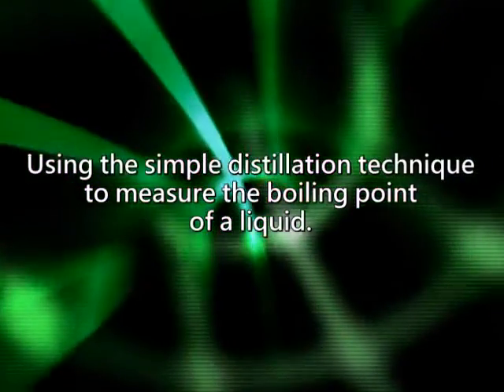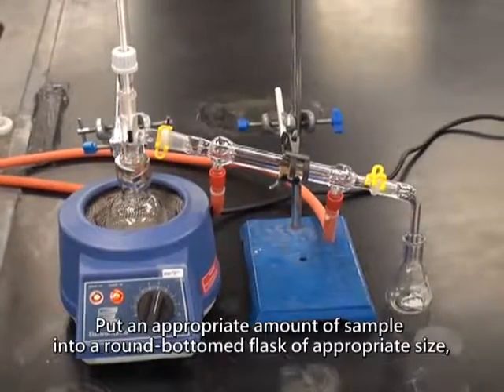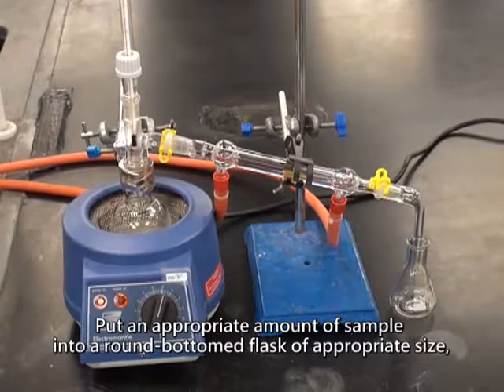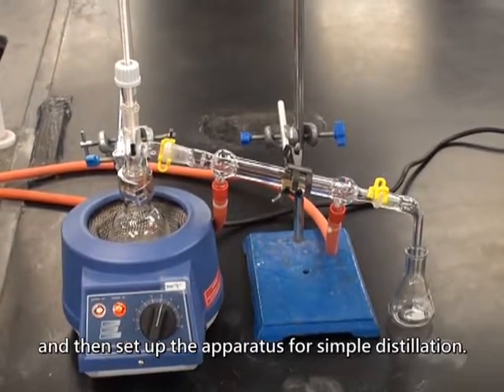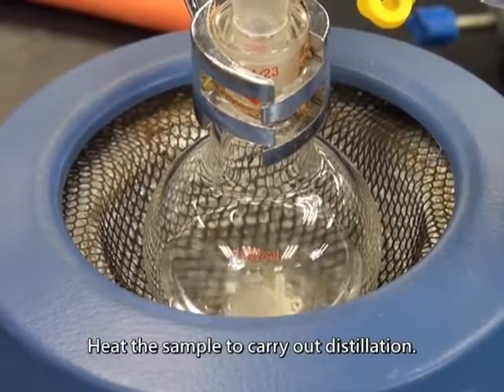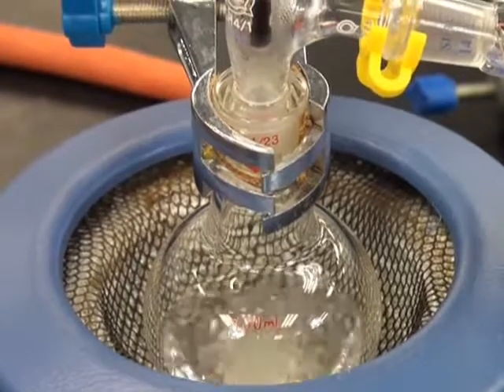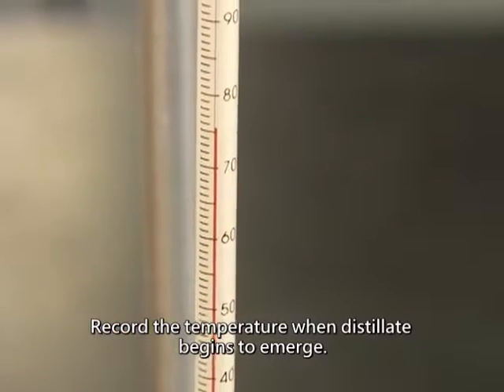Using the simple distillation technique to measure the boiling point of a liquid. Put an appropriate amount of sample into a round bottom flask of appropriate size, and then set up the apparatus for simple distillation. Heat the sample to carry out distillation. Record the temperature when distillate begins to emerge.